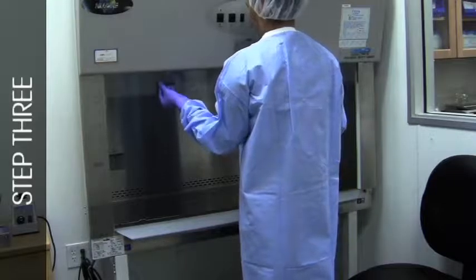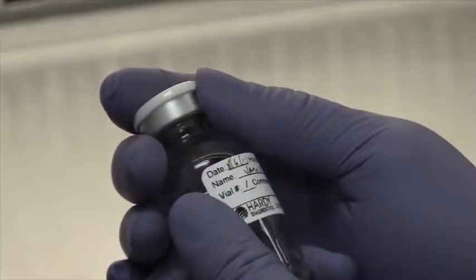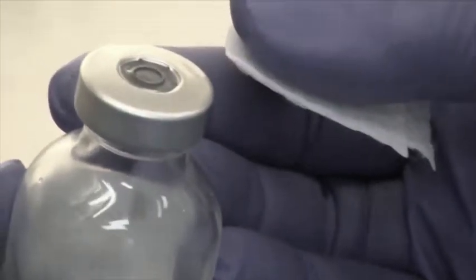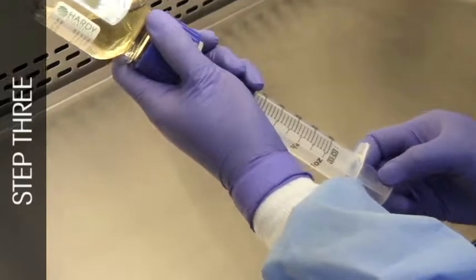Take the prepared non-sterile broth into the laminar flow workbench or isolator. Remove the tamper-evident seal caps. Clean the septum ports with a sterile 70% isopropyl alcohol wipe. Withdraw 25 ml of the broth using a 30 ml sterile syringe.